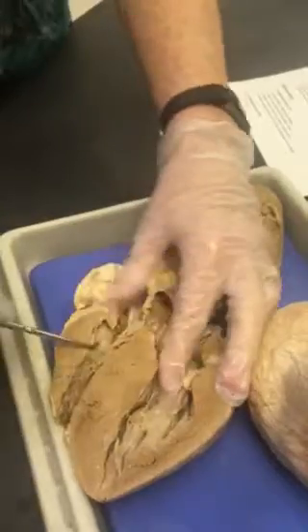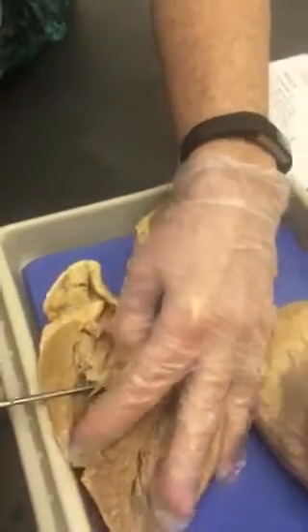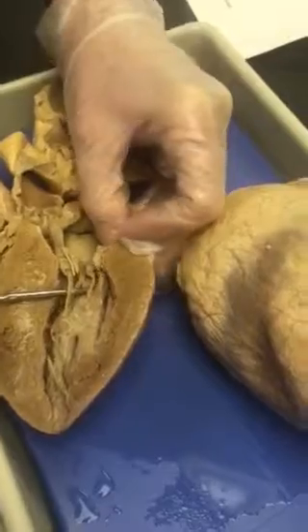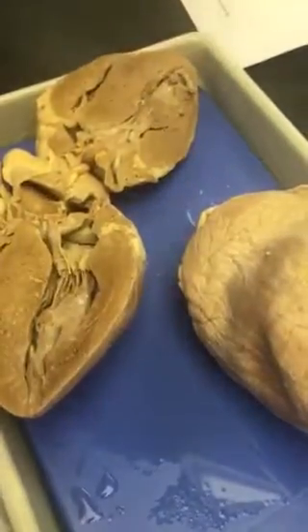Okay, on the right side, all right. Tricuspid. I was trying to get a piece of it up here, thin membrane. I've already mentioned the chordae tendineae. I'll probably just put a probe beneath the strings and say name the strings.